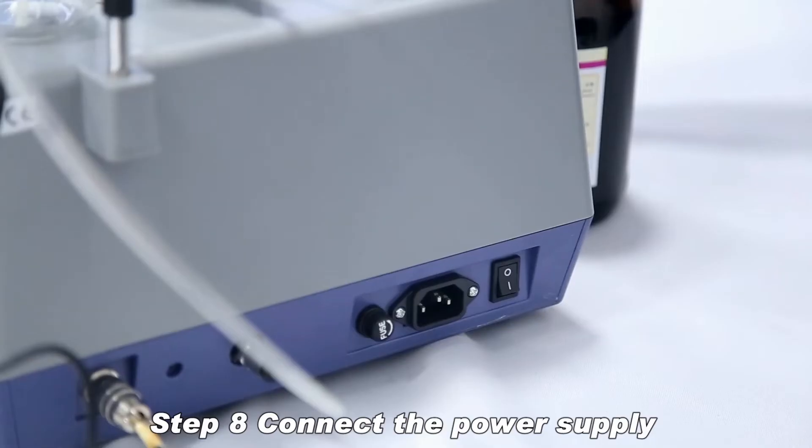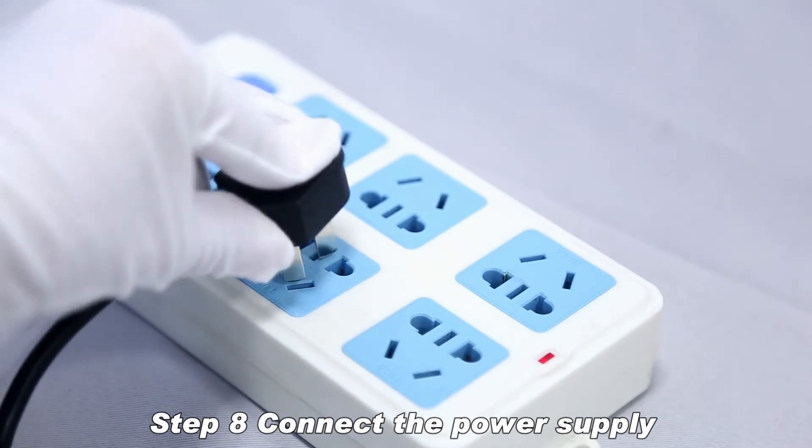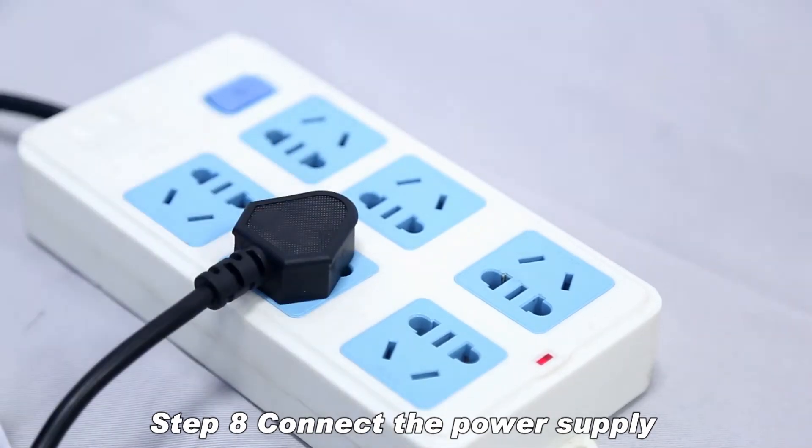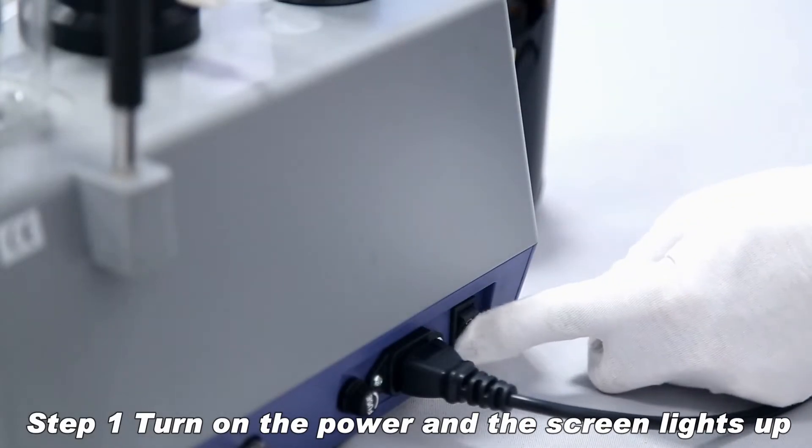Connect the power supply. Turn on the power and the screen lights up.